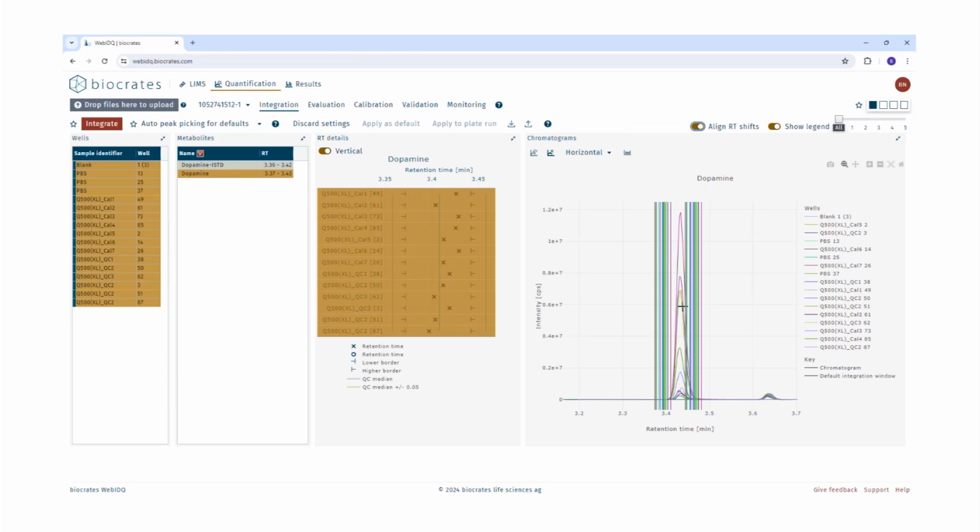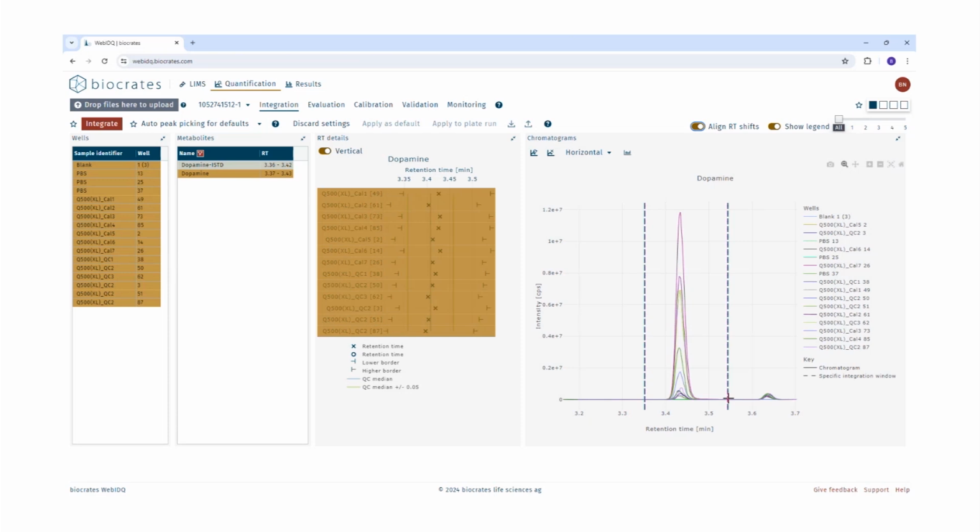And during the peak alignment, the integration windows from the previous view where we have seen the default integration windows are appearing at different times. So in this case, the default window of one metabolite for each well is shown because of the shifts in the retention time. So the magic here is WebIDQ can overlay all the samples on top of one another, and RT windows for the complete plate run in case of retention time shifts can be defined by clicking again on either side of the peak here, rather than defining for each well individually. And now here we can see these dashed lines are measurement specific integration windows, but due to the normalization procedure, they are appearing at the same time.